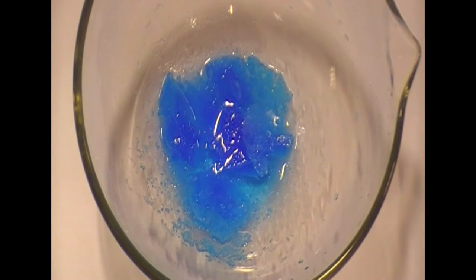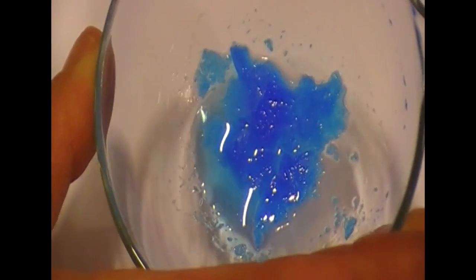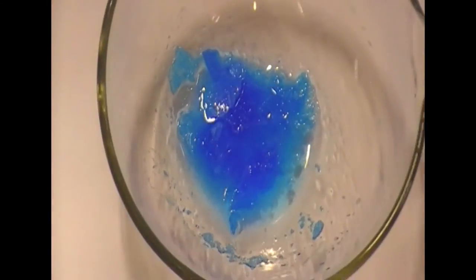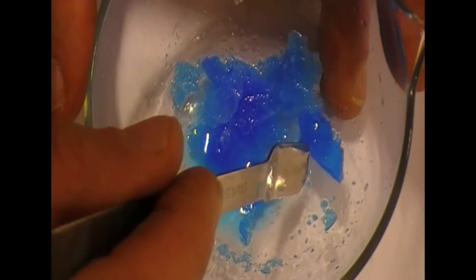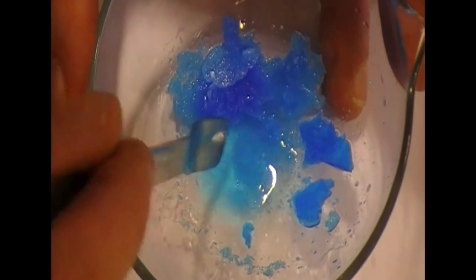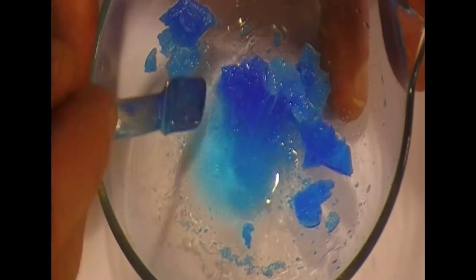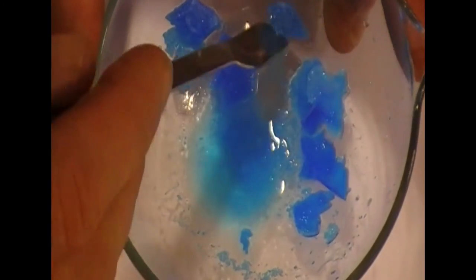Well, this has been left for a while and we've got quite a few crystals have grown in amongst. There's still a little bit of water left which is nice and it means it's probably going to be a bit easier to isolate an individual crystal. They've got quite a distinctive shape. Let's have a look. There's one.